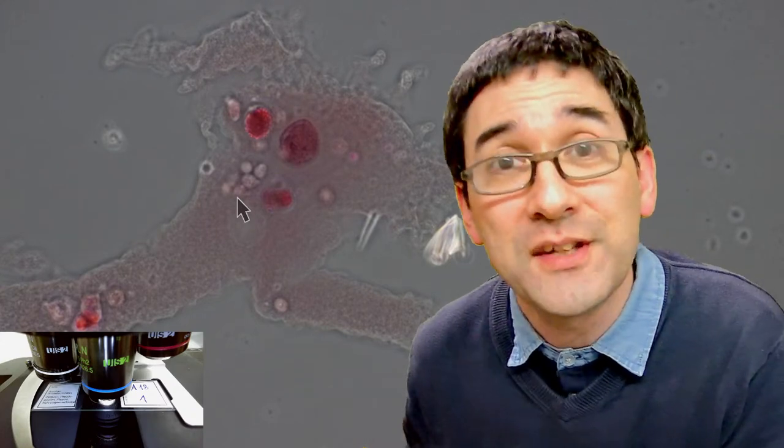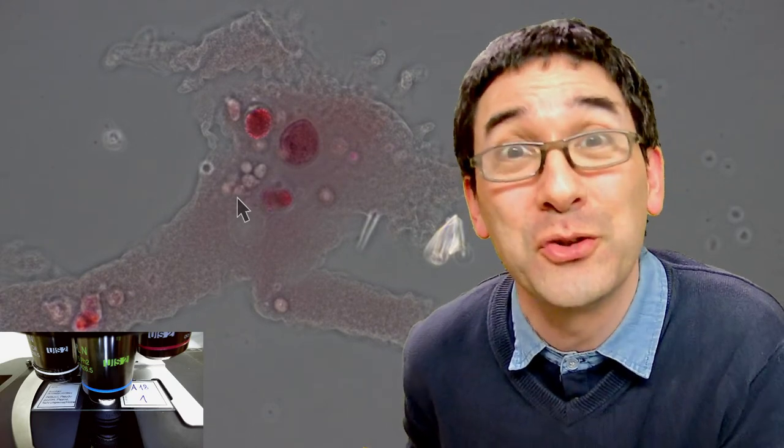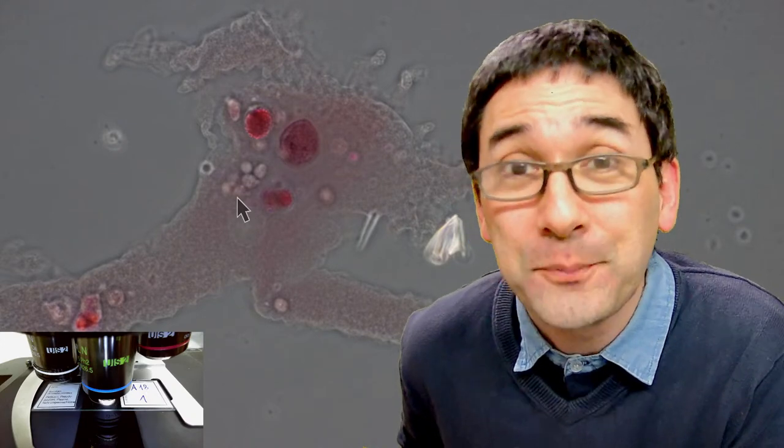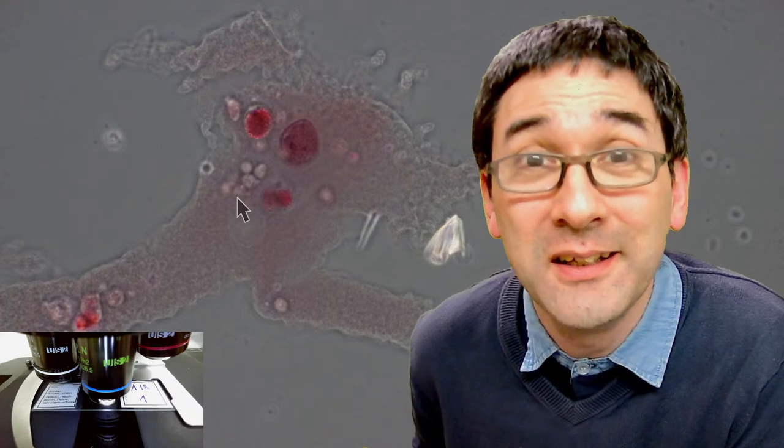Even if the specimen were not stained, we'd be able to see much better contrast with phase contrast. For transparent specimens, phase contrast is extremely useful. In this live stream I'd like to explain how it actually works and show examples — including cases where phase contrast is probably not the best solution. Feel free to ask questions in the chat, and I'll interrupt myself now and then to answer them.